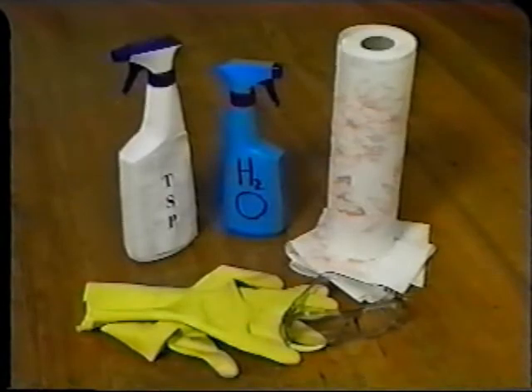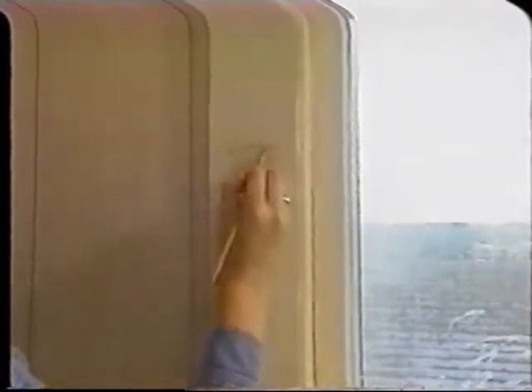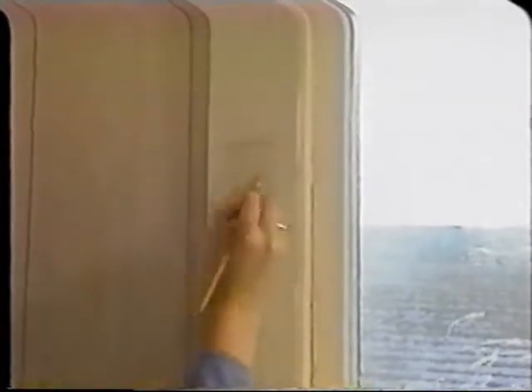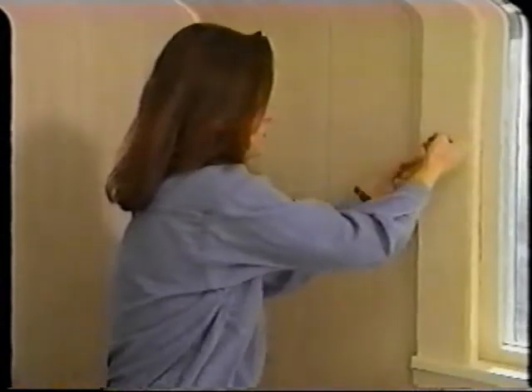First, clean and dry the surface so the tape will adhere to it. Next, cut a 3-inch piece of 2-inch wide clear tape. You want to fold over the top of the tape and then apply it to the surface. The tape should be applied evenly and smoothly. Using the end of a pencil, rub the tape onto the surface. After waiting about 90 seconds, remove the tape. If 1/16 of an inch or less of paint is attached to the tape, continue on to the final step.